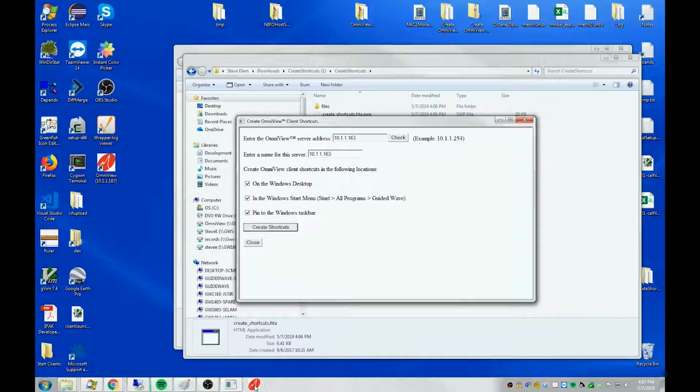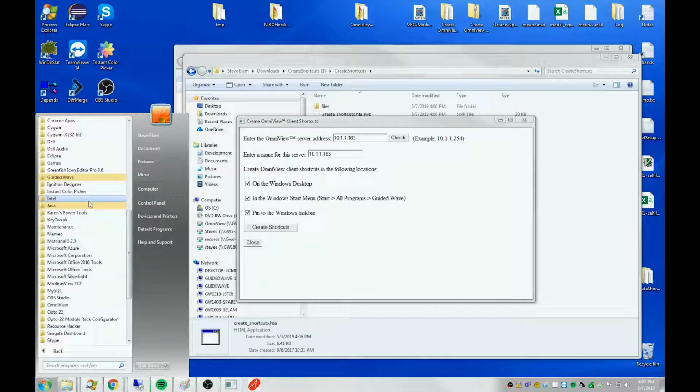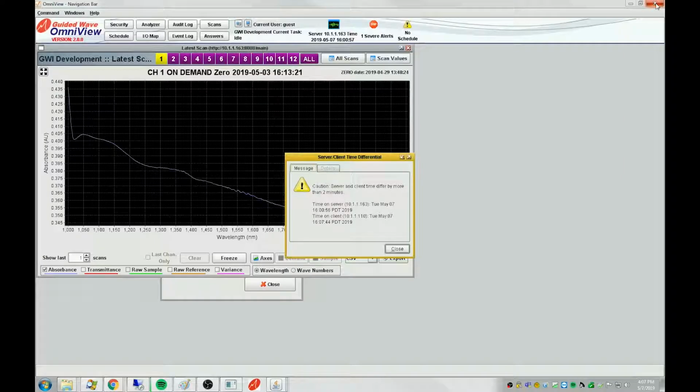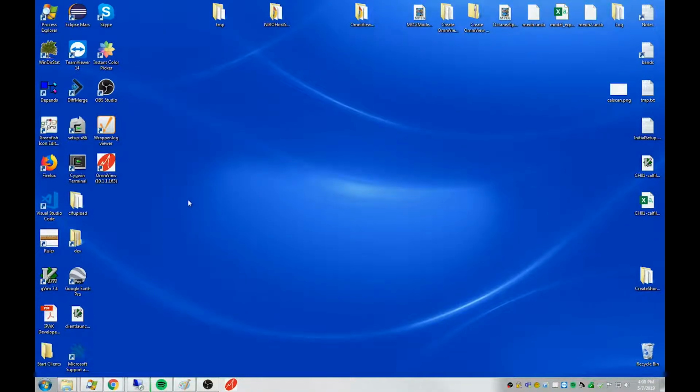There, you can see a shortcut here, and if you go into here, navigate down to Guided Wave, there's a shortcut there. You can create all three or only one, it's up to you. And again, you see the client starting. So those shortcuts are now always available, so I don't have to go through the website anymore. Now, this is what we have provided on newer versions of OmniView coming out of the factory.